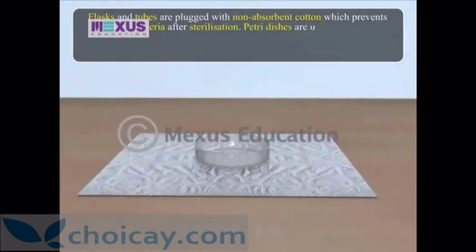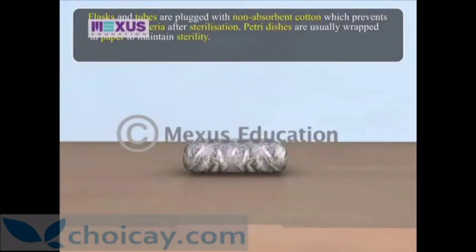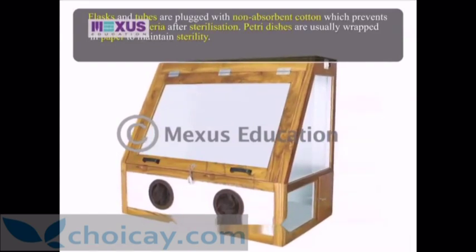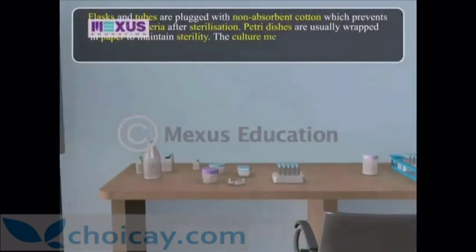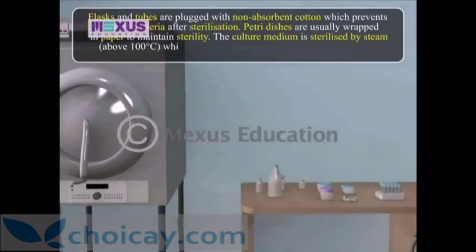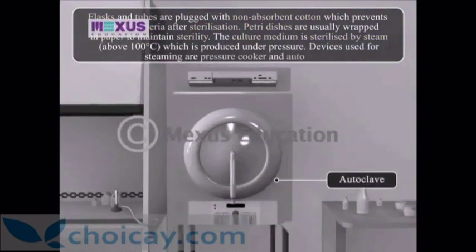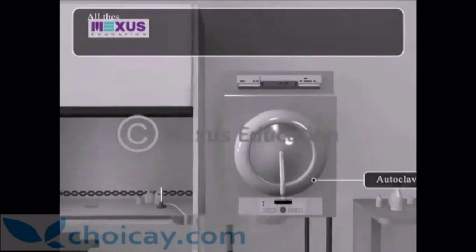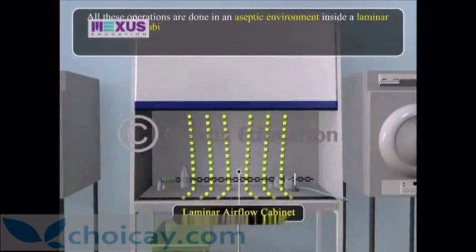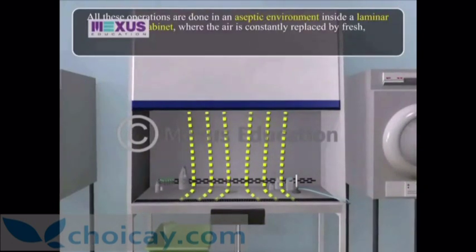Flasks and tubes are plugged with non-absorbent cotton, which prevents entry of bacteria after sterilization. Petri dishes are usually wrapped in paper to maintain sterility. The inoculation chamber is usually sterilized by ultraviolet rays. The culture medium is sterilized by steam above 100°C, produced under pressure using devices like pressure cookers and autoclaves. All these operations are done in an aseptic environment inside a laminar airflow cabinet, where the air is constantly replaced by fresh, filter-sterilized air.